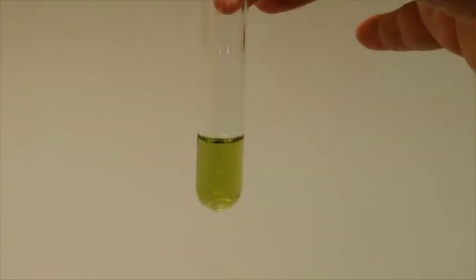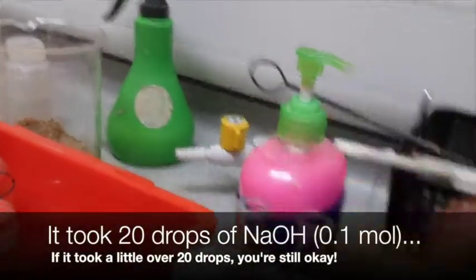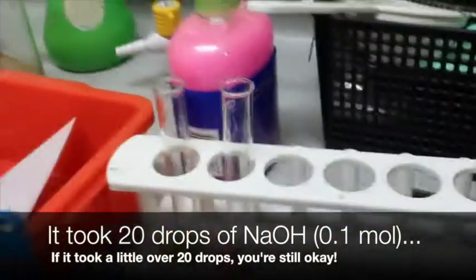20. We have a bright green neutralized substance. Now that is for 0.1. It took 20 drops of the 0.1.